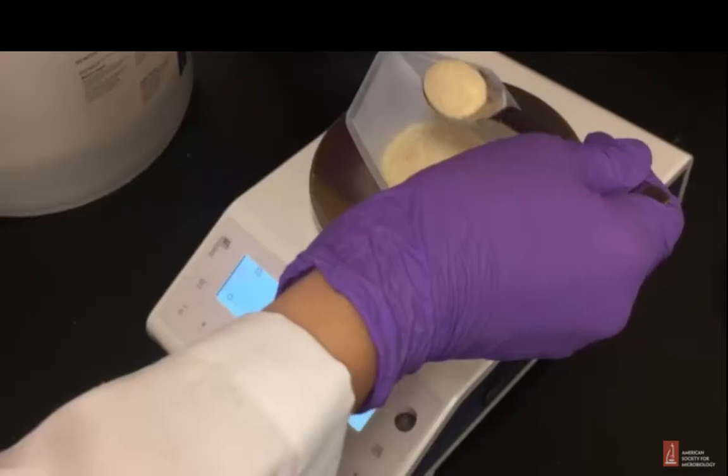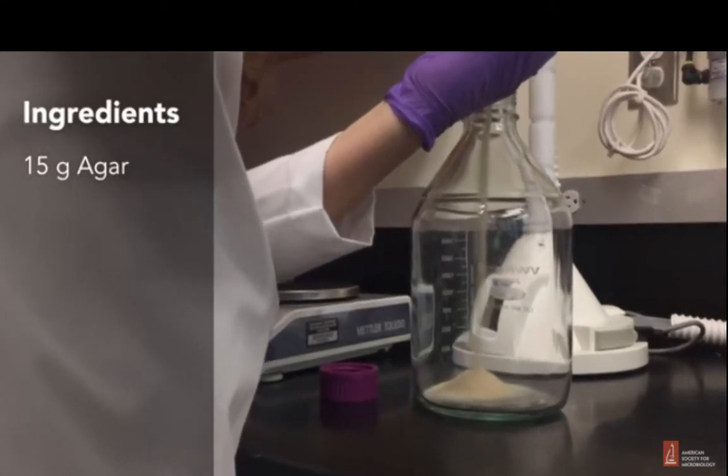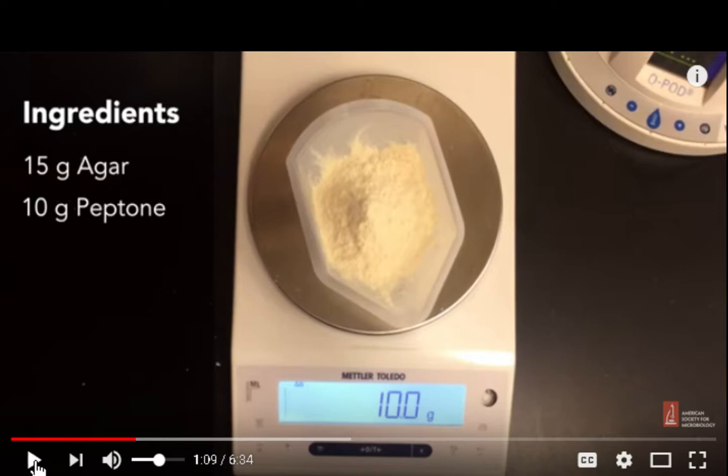In order to prepare our 1 liter of agar, we need to weigh 15 grams of agar and add it to the bottle. We then need to weigh and add... So 15 grams, that relates to 1.5 grams in 100 milliliters, according to this particular video. And I don't know what peptone is. So they're using an agar peptone mix.